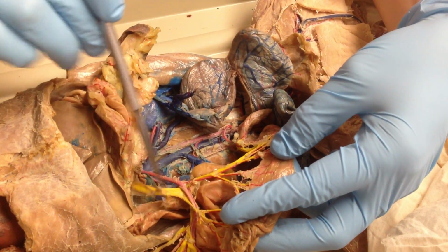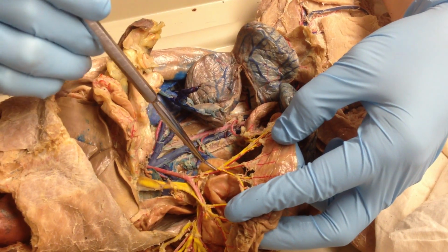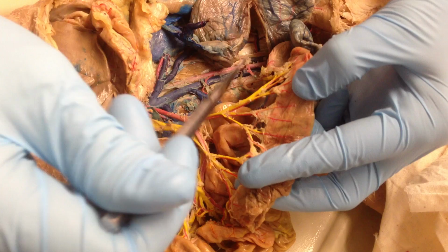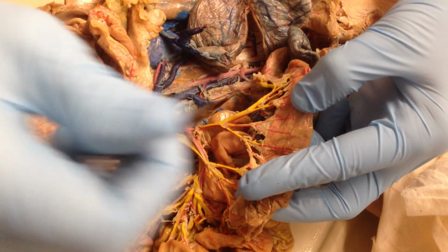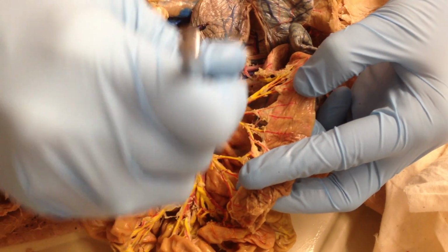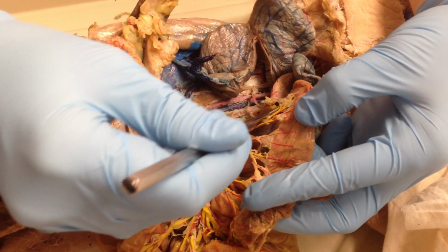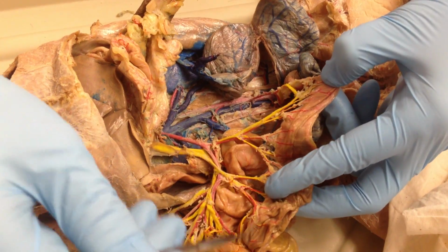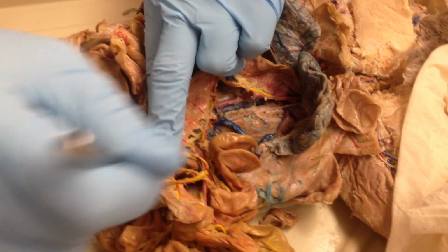The veins go superior mesenteric as soon as it branches here. This is now inferior mesenteric. It doesn't have an inferior portion down here like the arteries do. It's first inferior here, then it becomes left, and left continues all the way along. You have ileocolic up the front and right colic up the back.